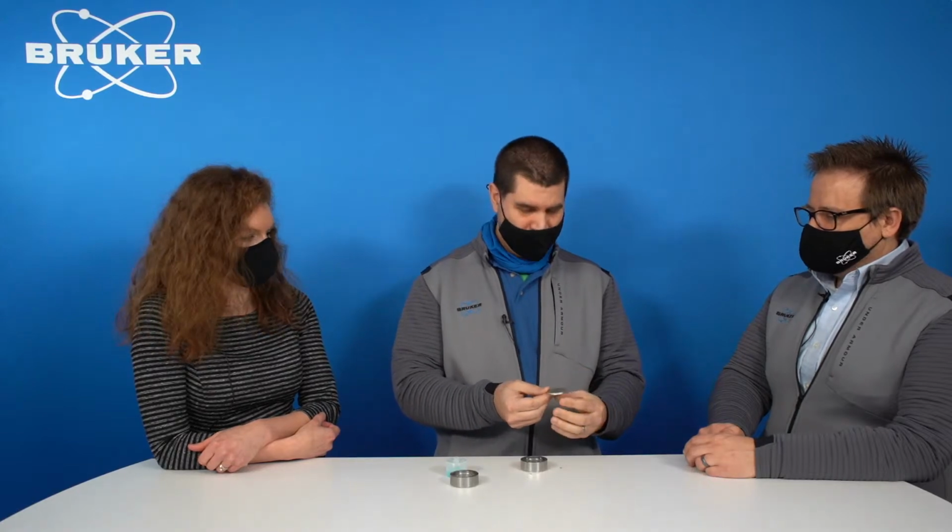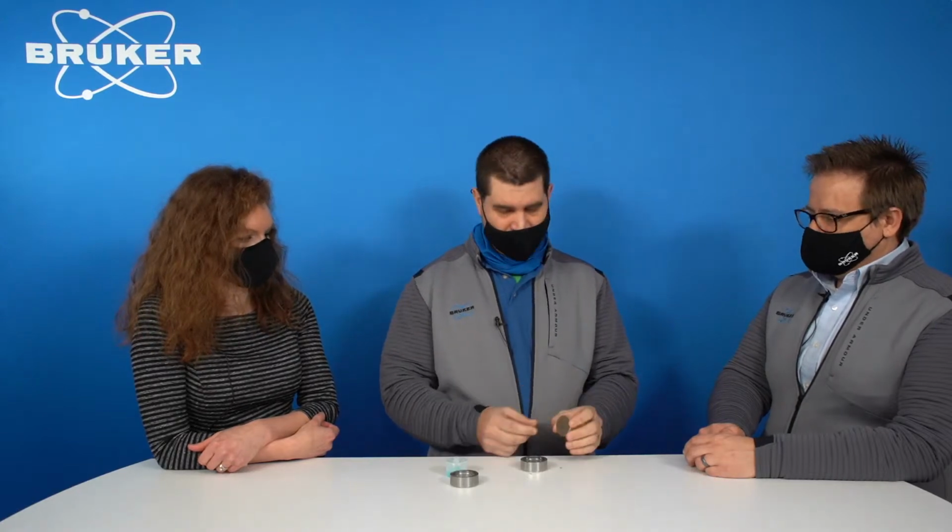Well, it also depends on the steel sample, the density, and what elements you're looking at. With lighter elements you're looking more at the surface, and with heavier elements you're looking further into your sample. For a geological sample or a cement sample, like this sample right here, we consider it to be infinitely thick. If we're measuring oil samples and looking at sulfur, half this cup would be considered infinitely thick as well. The samples don't have to be gigantic, but it depends on which element and which line you're looking at, the K alpha line or the L alpha line, and the density of the sample.